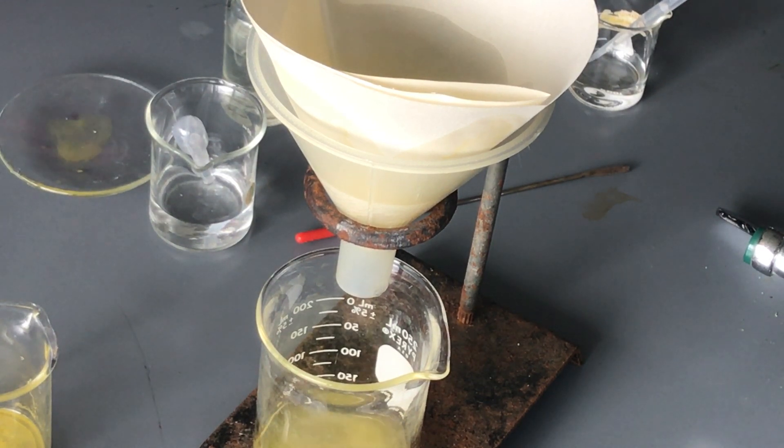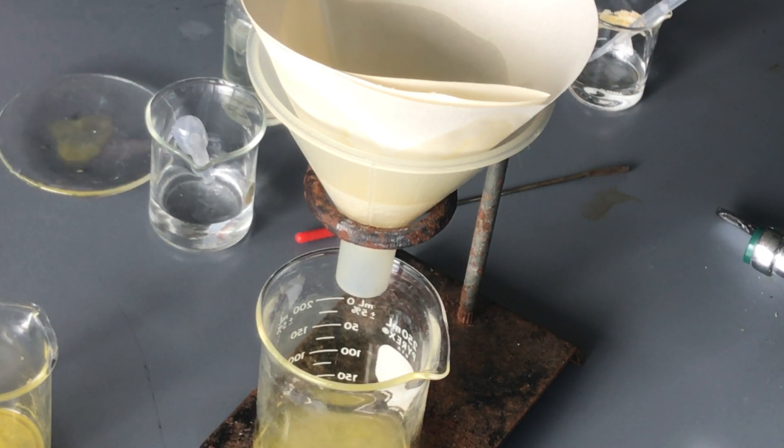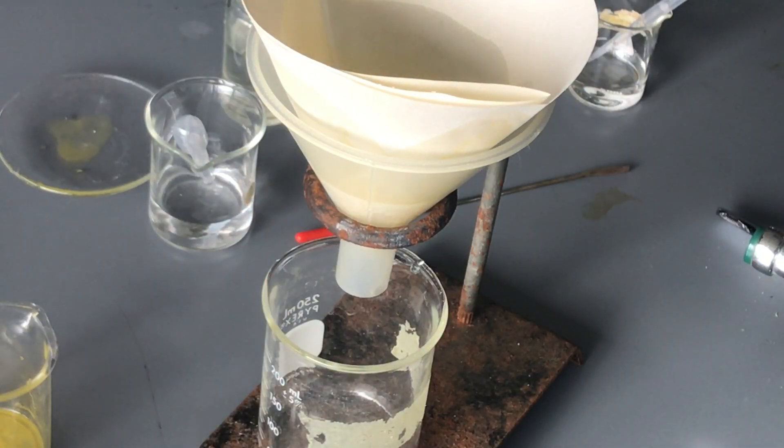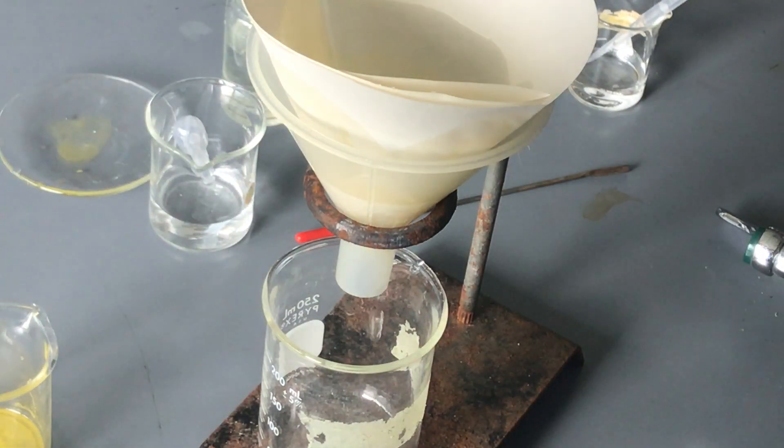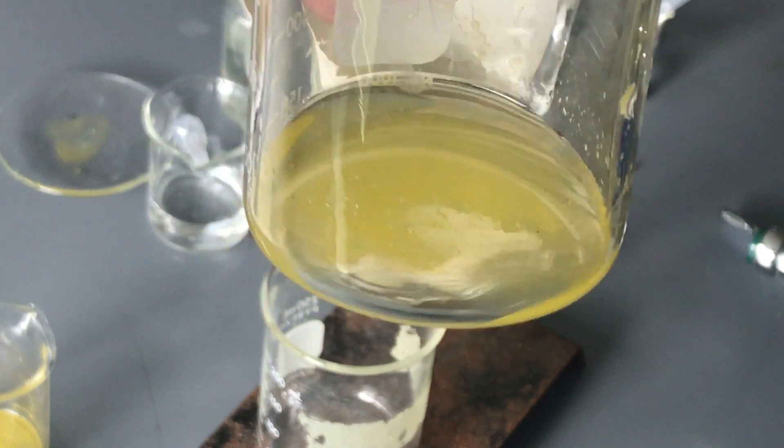This is slowing down a little bit. We see that it's a little bit clearer coming down out of the dripping, at least from my perspective that's what I'm seeing. And so I'm gonna switch out beakers here, we're doing this live in the lab. And I'm gonna just switch out beakers. And if you notice again I got a little yellow, see if I can put it at the right angle here. And there we go, so it's clearer than what the originals were.